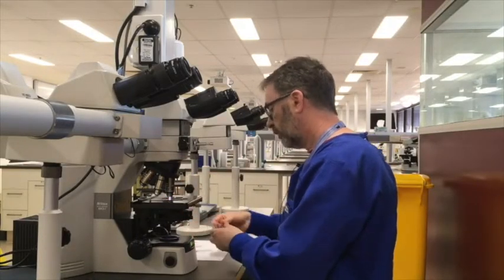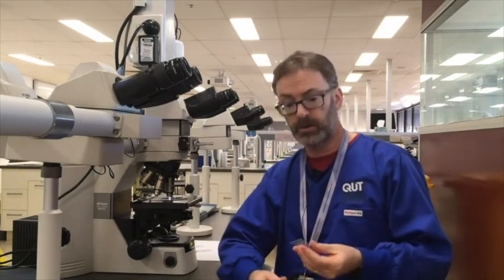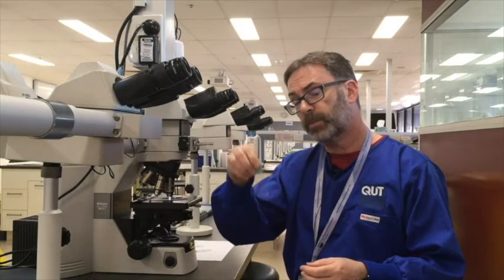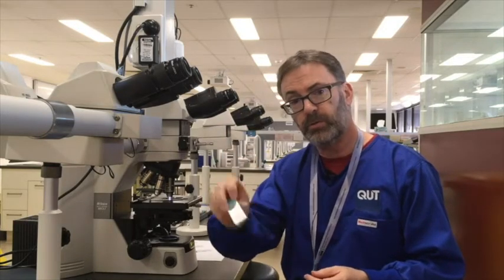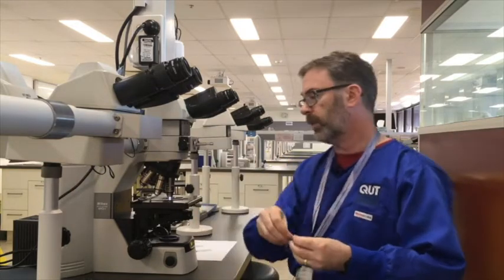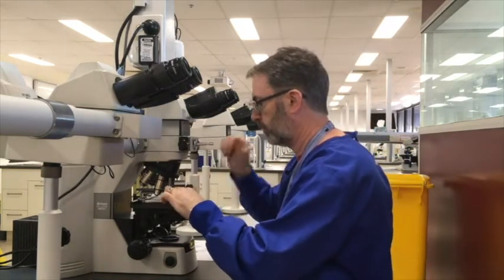So ordinarily, therefore, what you need to do is to differentiate your slide in the acid alcohol. For how long? That's sometimes the question that is difficult to answer. In general, a few quick dips in the acid alcohol, straight to the water bath to rinse, re-blue, and you should get something that looks a little bit like this slide.